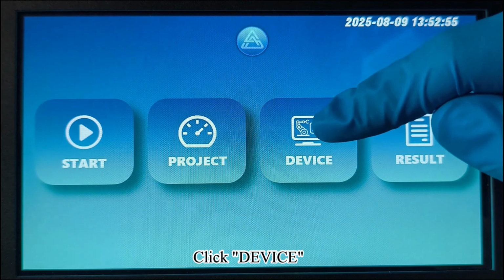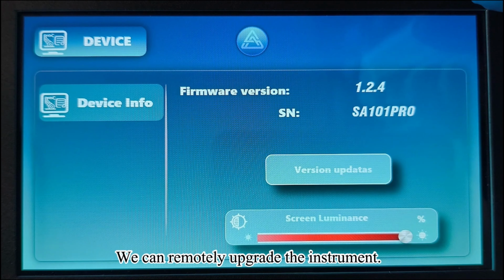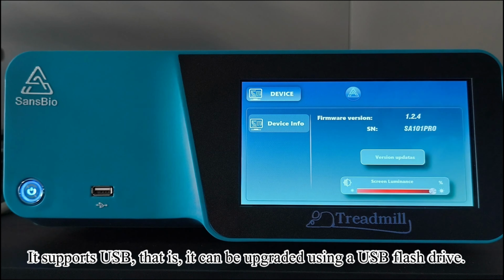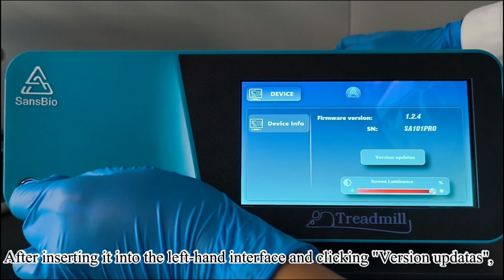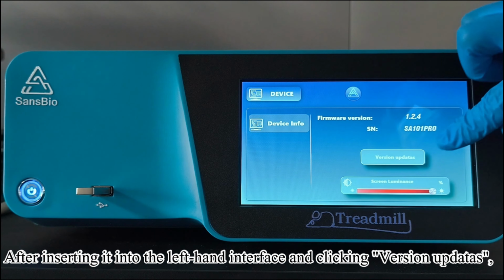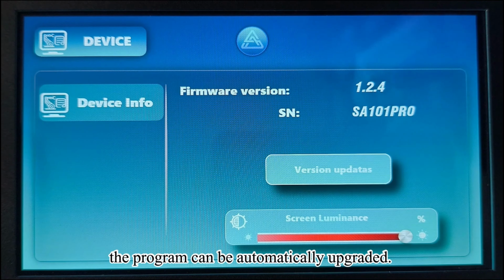Click Device. We can remotely upgrade the instrument. It supports USB, that is, it can be upgraded using a USB flash drive. After inserting it into the left-hand interface and clicking Version Updaters, the program can be automatically upgraded.